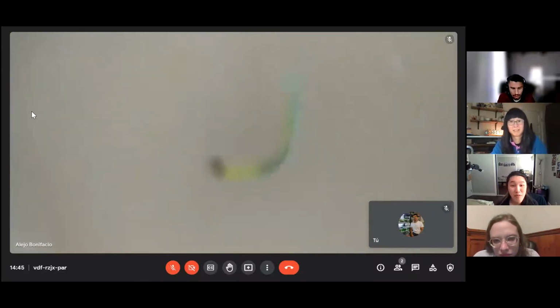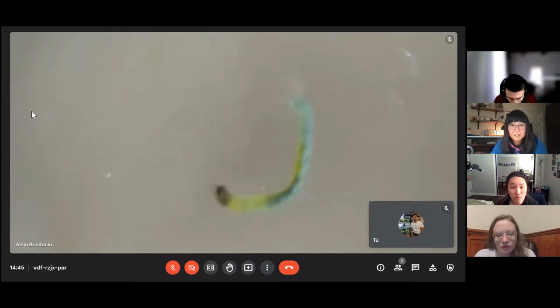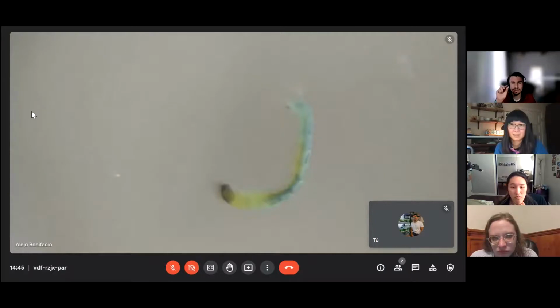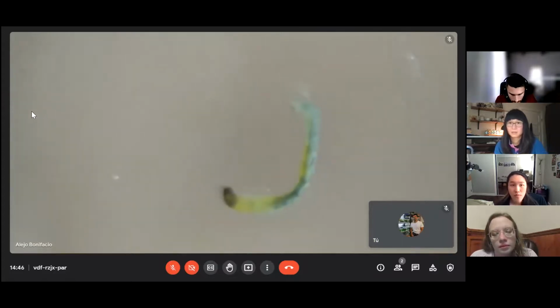But there is another kind of chironomids that are more green. They look so similar because it depends on the stage. In the first stage, after they leave the egg, they are very small, and this is very tiny, and you can only see it in detail on the microscope.